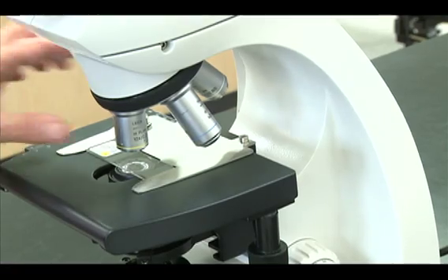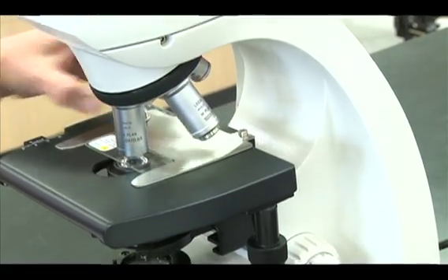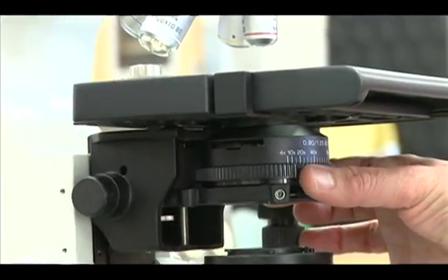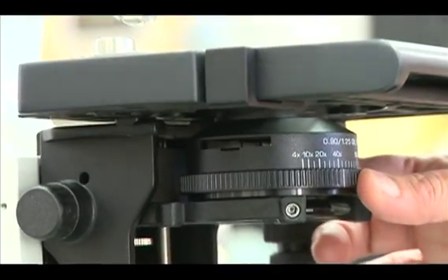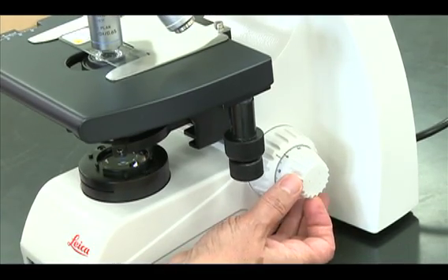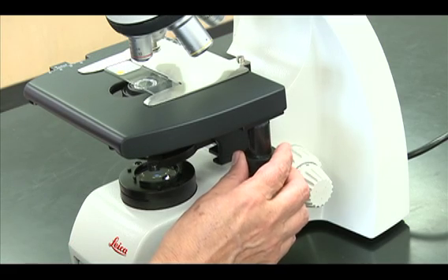Rotate the 40x objective into position and set the iris diaphragm ring to 40x. Focus with the fine adjustment knob only until the image is in perfect focus and scan your slide.